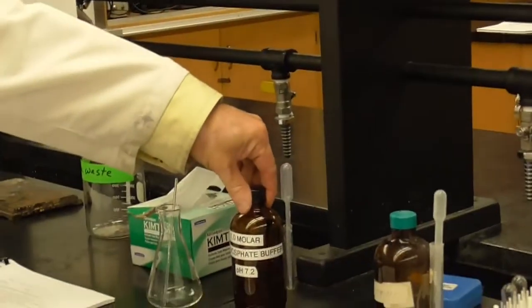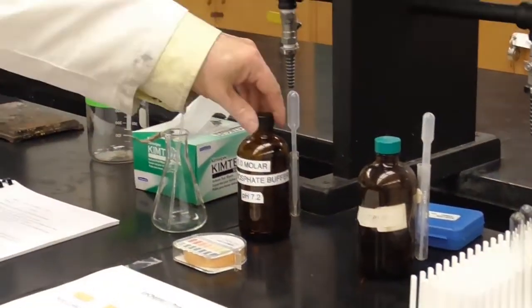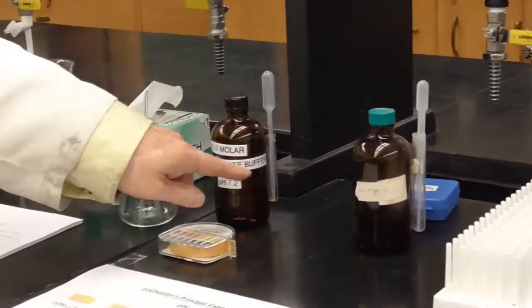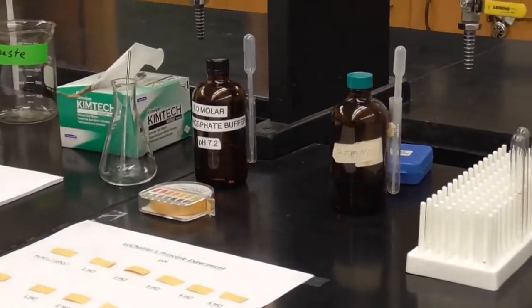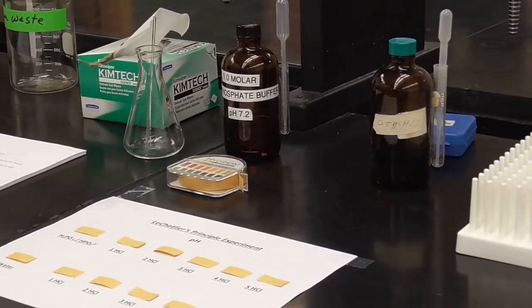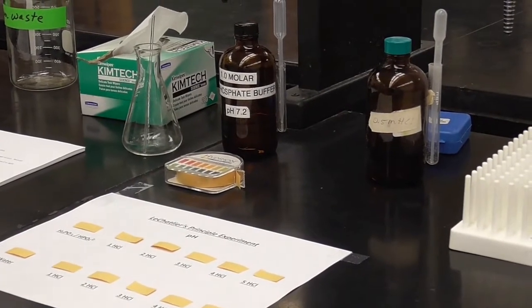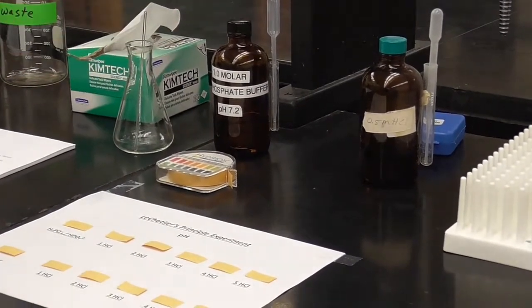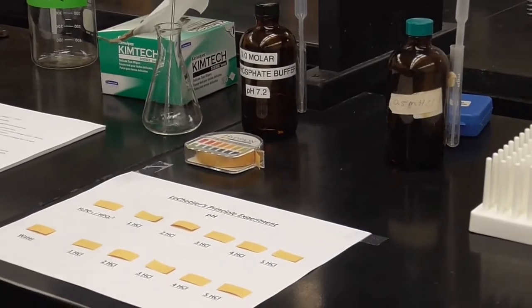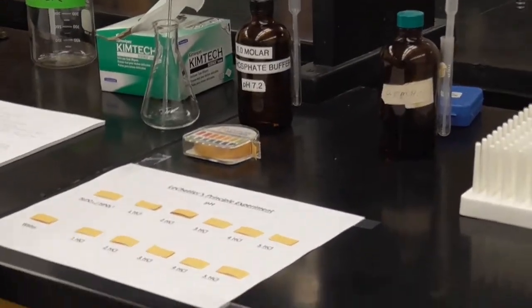All right, here I've got the phosphate buffer and the hydrochloric acid that I can adjust with. Why does it say buffer? Because remember, a buffer is both the weak acid and the conjugate base at the same time in solution. So exactly what we have with that equilibrium. We have the one with the 2 protons, we have the one with just the 1 proton, right? The di and the monohydrogen phosphates, and so that's a buffer. Okay. So they're both in there right now in equilibrium with each other.